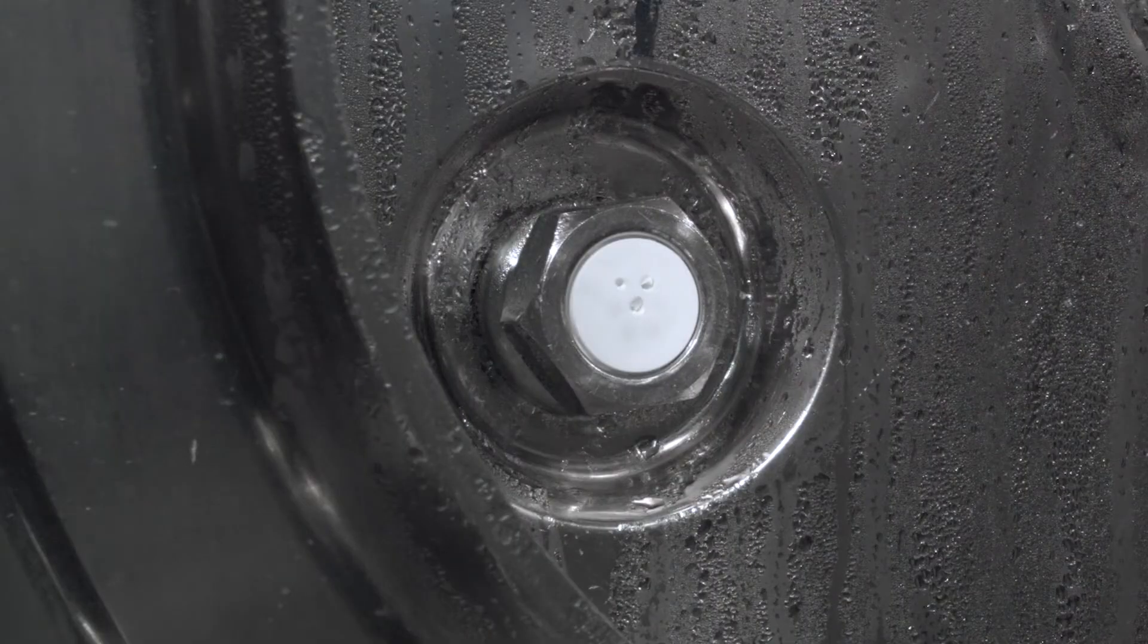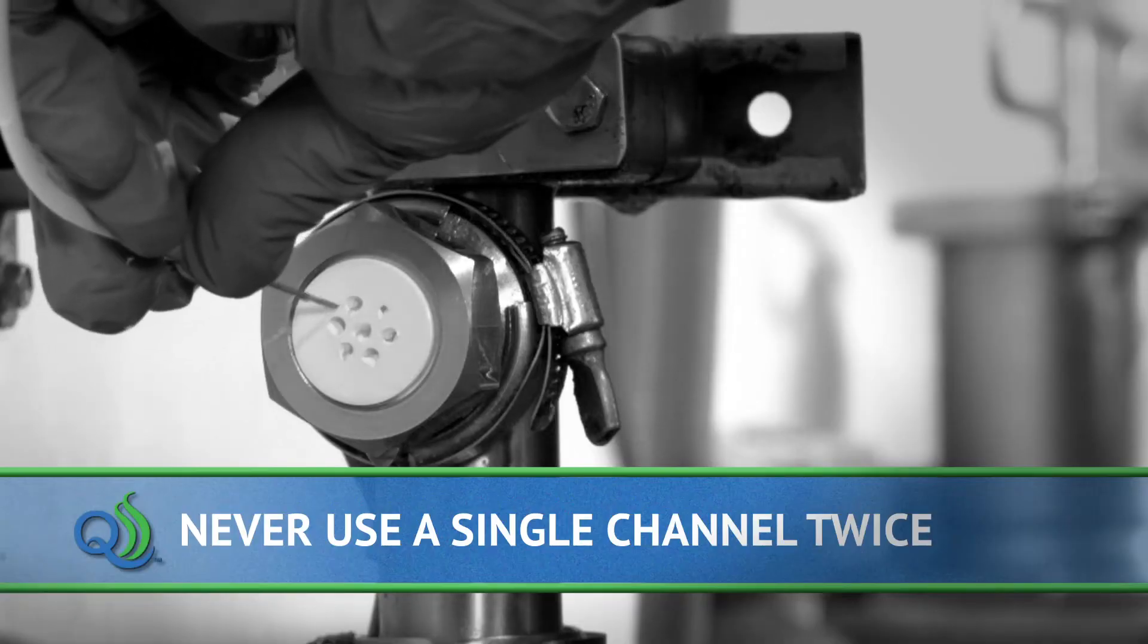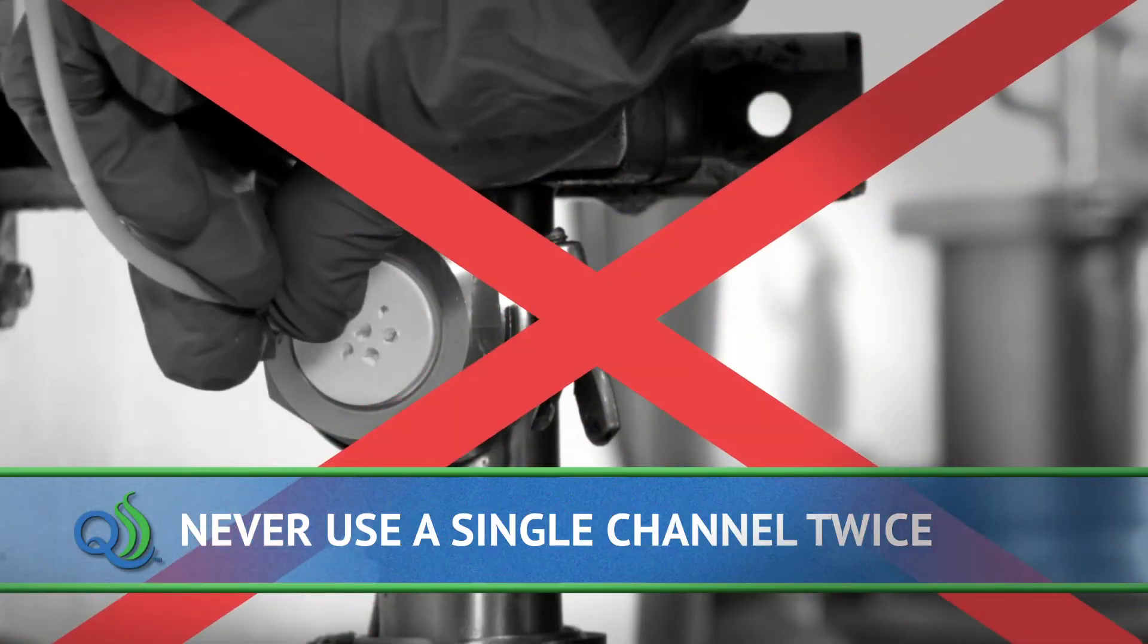Once punctured by a needle, the front surface of the septum will clearly show which channels have been used. To avoid contamination, never use a single channel twice.